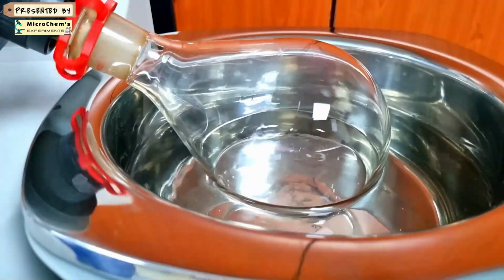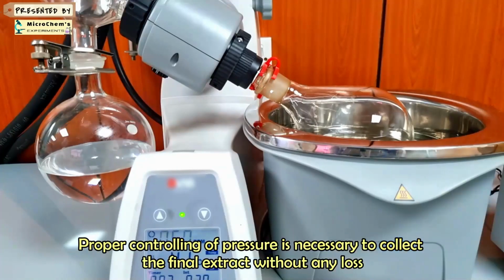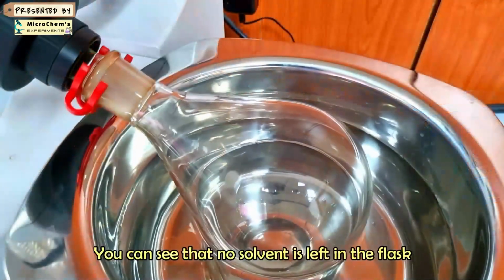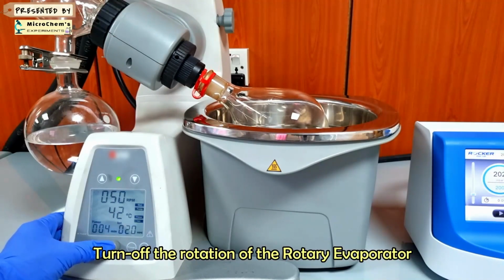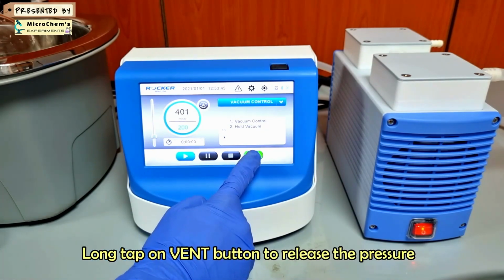Rotary evaporator should be connected with a vacuum controller unit and a vacuum pump to control its internal pressure accurately and efficiently. Proper controlling of pressure is necessary to collect the final extract without any loss. Proper controlling of pressure can be ensured by using the setup of ROCKER scientific equipment. Solvent is evaporated completely from the flask. Tap on stop button to stop controlling the pressure and long tap on vent button to release the pressure.